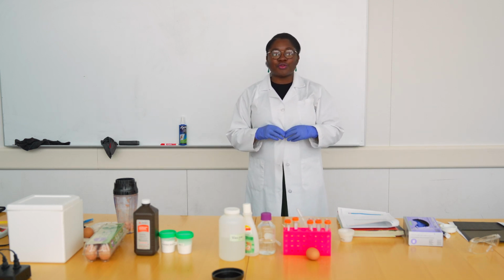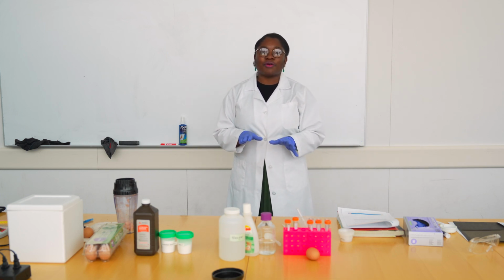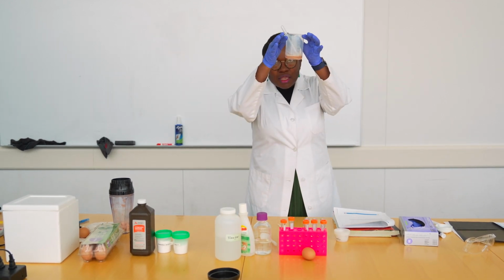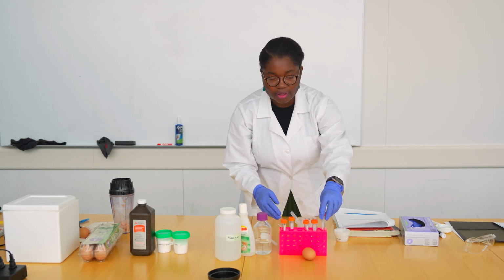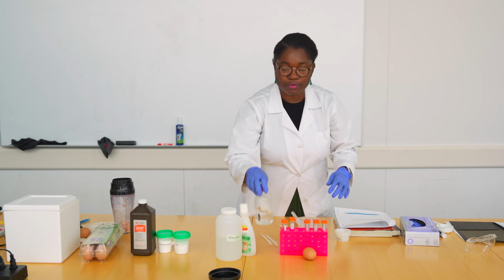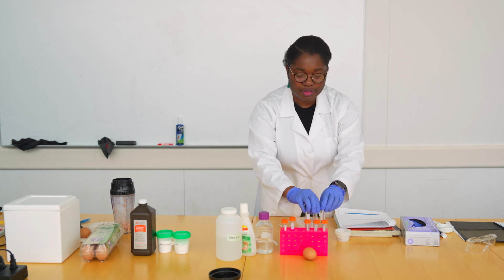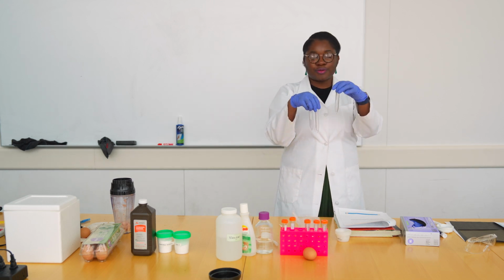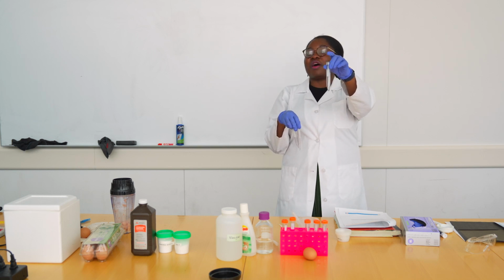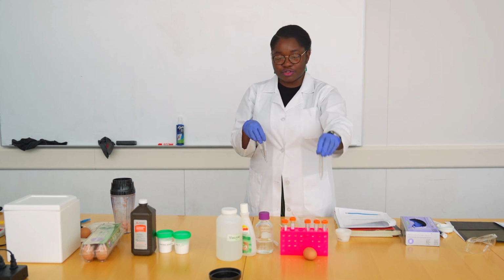Now we are going to do a different experiment where we are going to assess the effect of vinegar on the previous reaction. So we are still going to be using our trusty potato juice with some hydrogen peroxide and vinegar. And this time we are going to add water as a control. So we have 3 empty tubes that are going to be our 3 reaction tubes. One is going to be our test tube, where we are testing what vinegar does to the reaction between the catalase in the potato and the hydrogen peroxide.